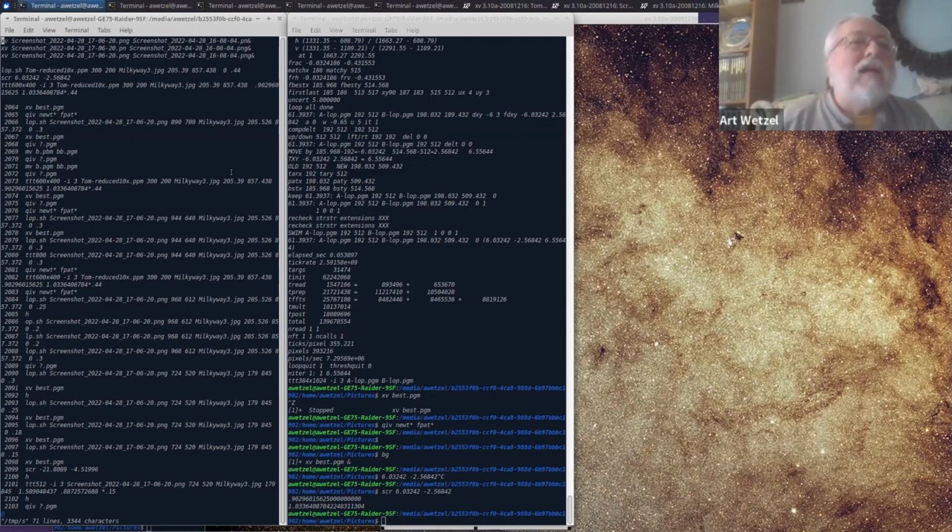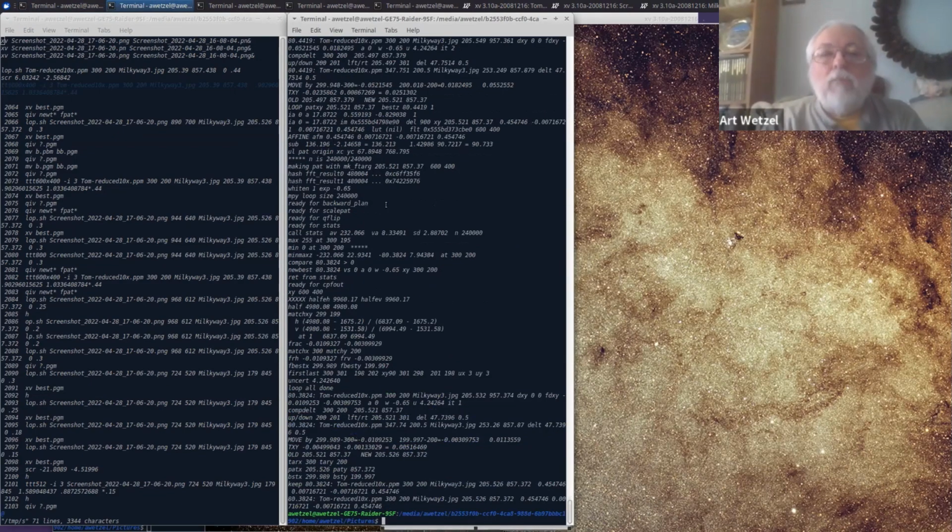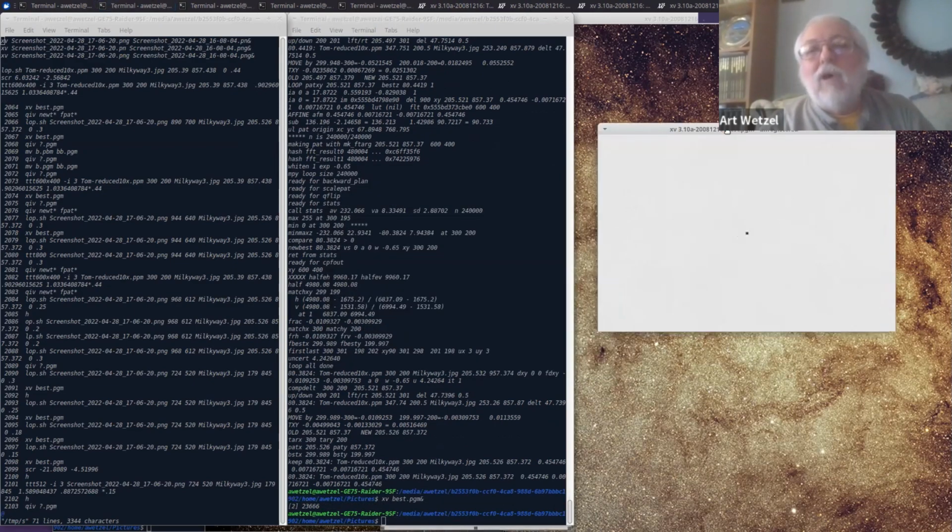So using that information, and maybe jumping ahead a little bit, that I can discuss if needed, leads us to the next step, which is to go back then to a simple translation type of motion. So we use the polar and scale information to help us get the XY position, which I just did. And there's our spot again. Always like to look at that spot.